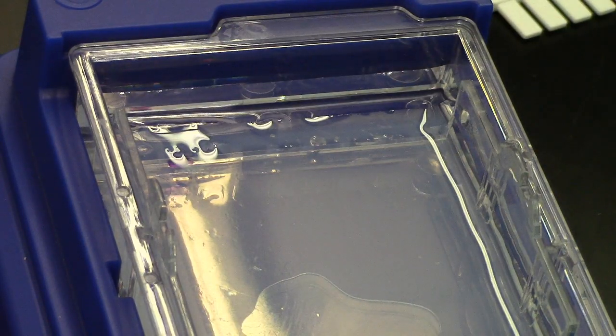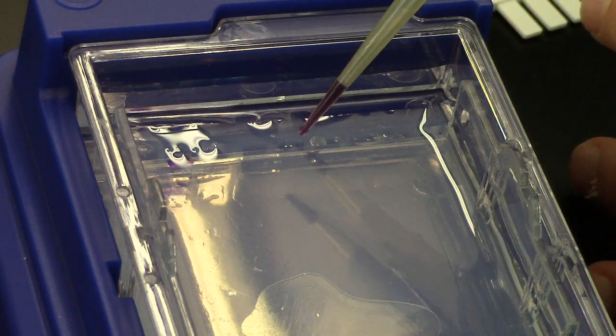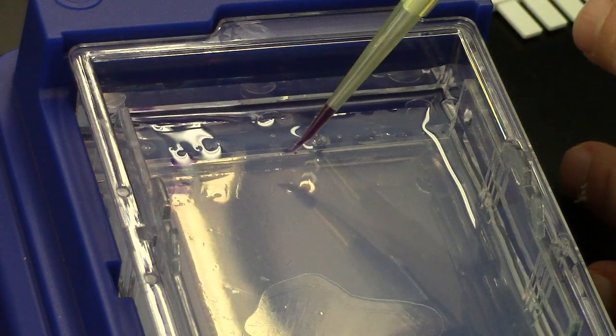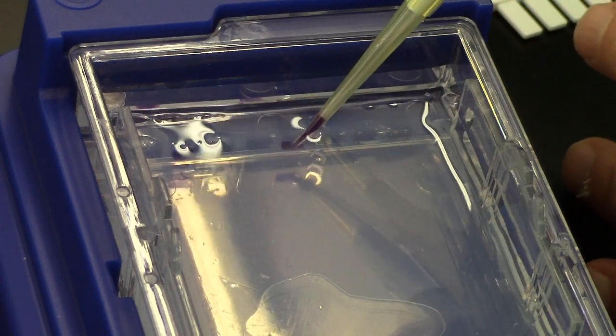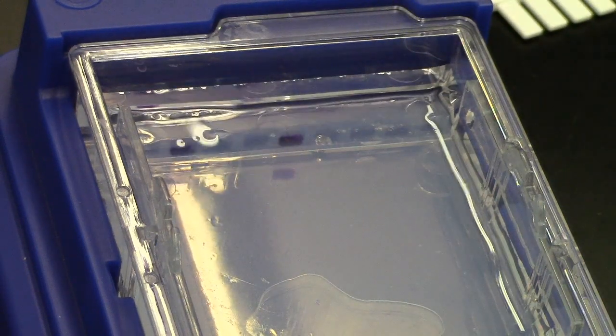In order to load, position your pipette on top of the well you want to put your sample into. Slowly release - your sample will sink into the well - and then withdraw your pipette tip.